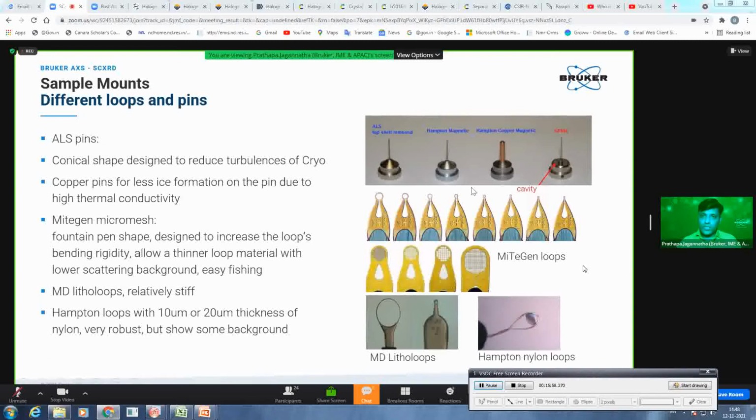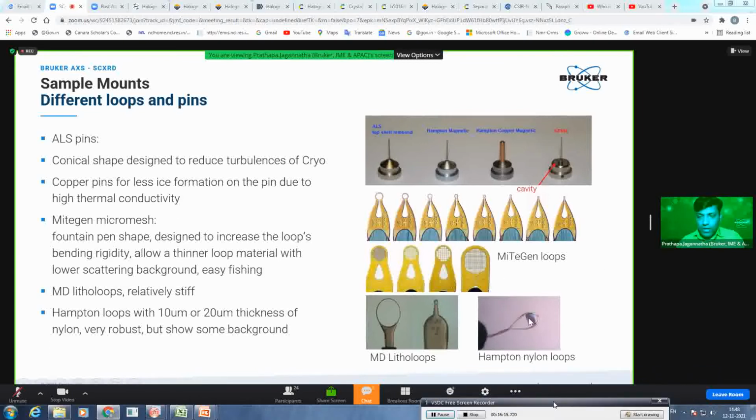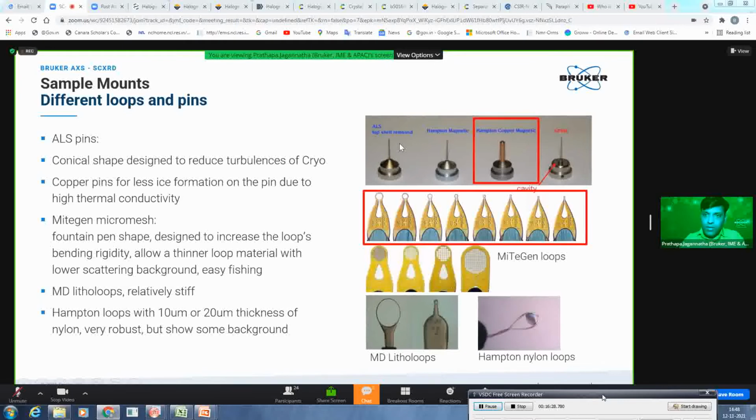So that's why it has these kinds of shapes, and it is available in different sizes, so you can use different sizes of loops for different size crystals. You also can use regular Hampton loops, which are made of nylon. Of course, you can observe slightly more background compared to these MicroMounts, but feel free to use them as well. But the copper pins will be very nice with the magnetic base, which will help you have less ice formation compared to these steel pins.